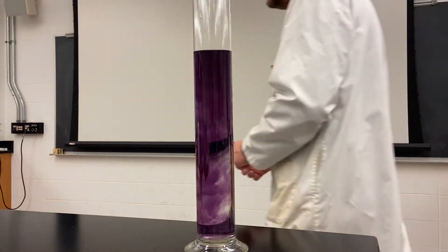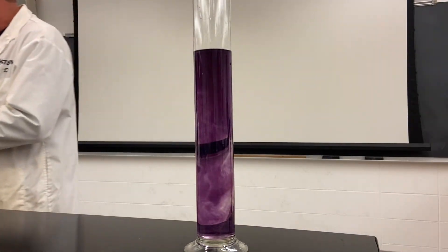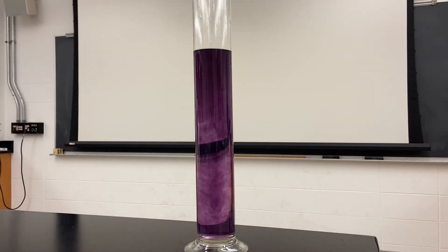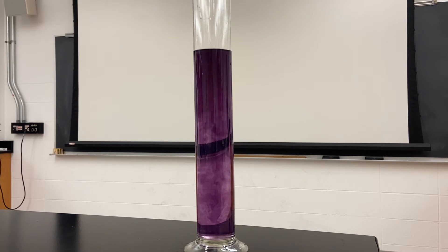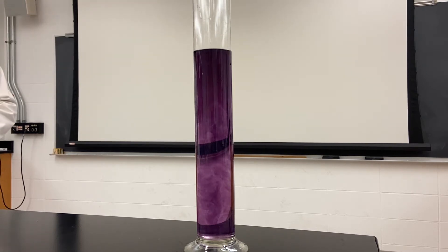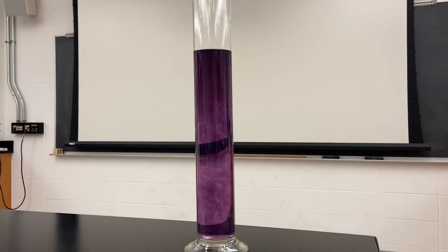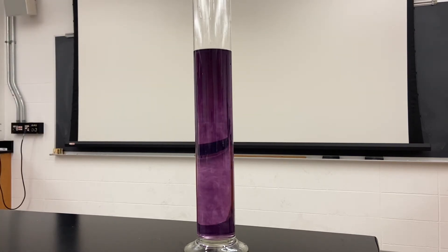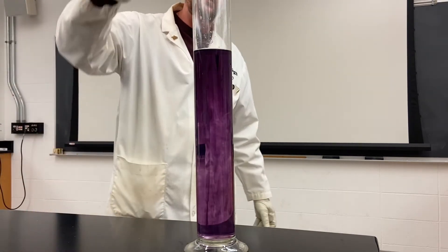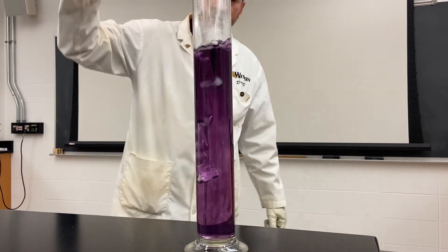What we're going to do is take some dry ice and add it to that tube. I've got some small pieces of dry ice here, and we're going to drop them in and watch the color change as a result.